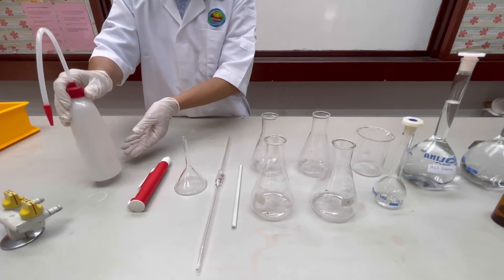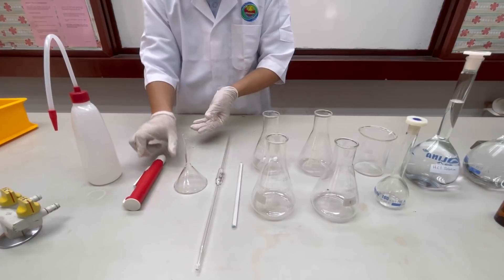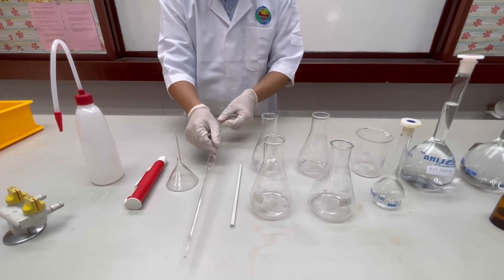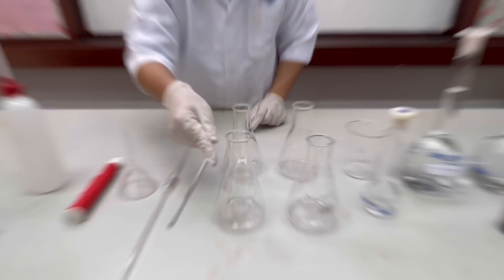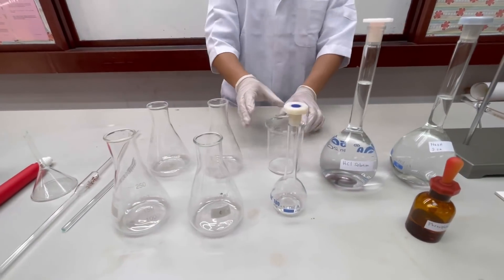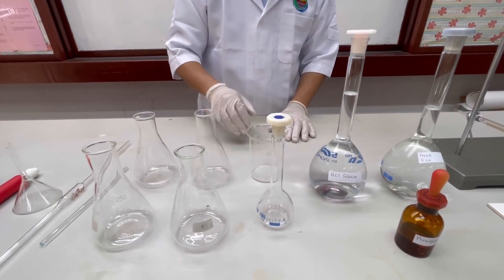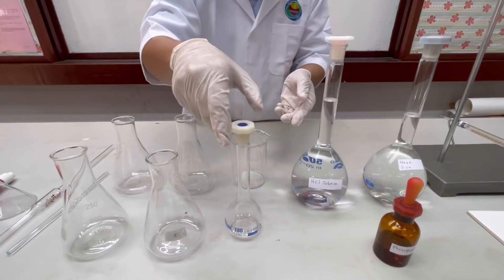Distilled water, pipette filler, filter funnel, 10 ml pipette, glass rod, 4 conical flasks, beaker, 100 ml volumetric flask.